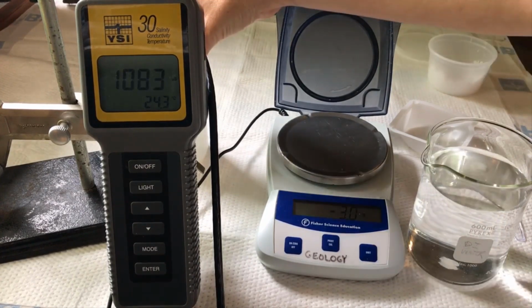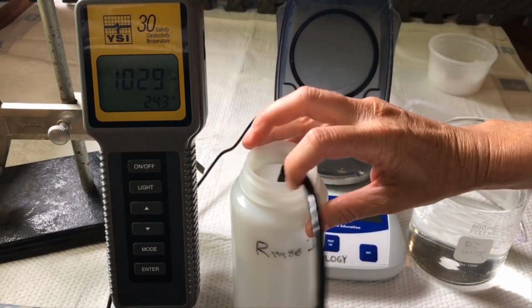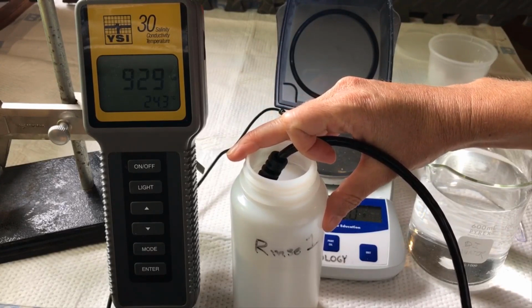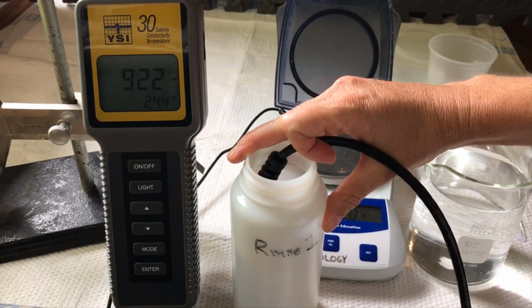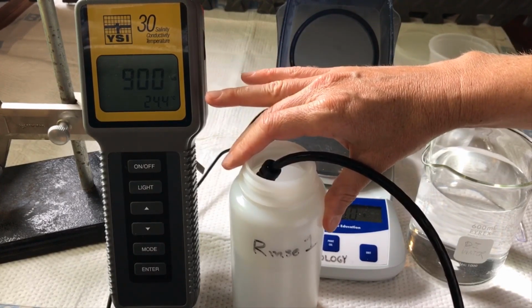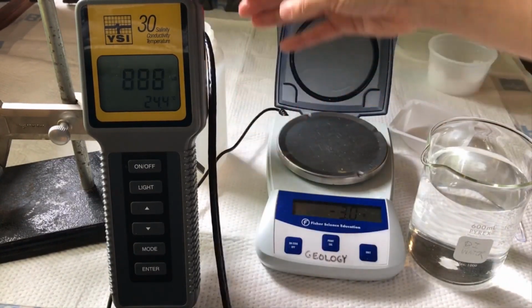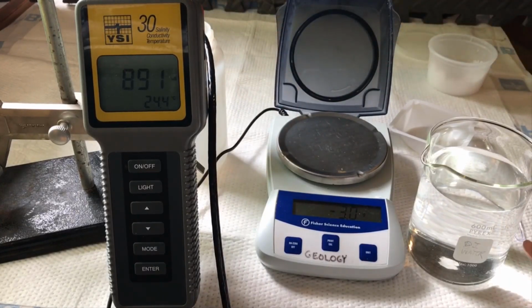You also might notice that if you were looking at the readings of my conductivity meter, between each solution I've been putting the probe in this rinse beaker or rinse container that contained deionized water, and the conductivity of this water has increased throughout our experiment. So that is also another source of error where if I didn't get the probe completely dried off before I put it into my solution, it's possible that I actually increased the salinity of the solution. So those would be the possible errors in this experiment, and they're in every experiment.